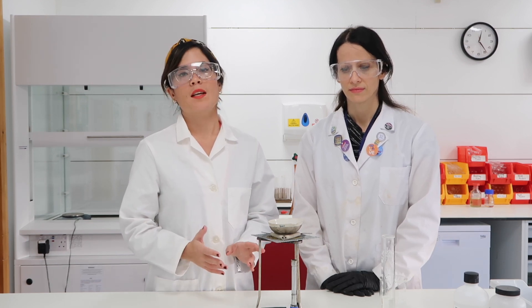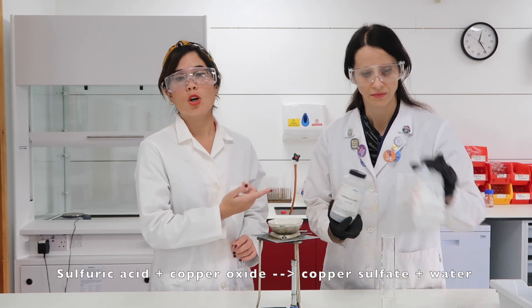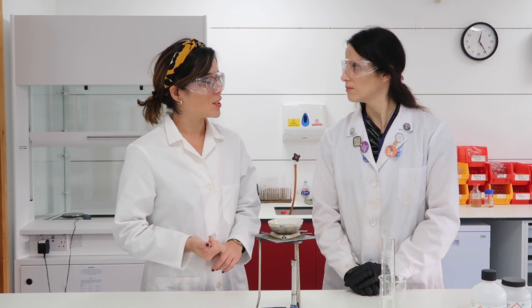However, we're going to be making copper sulfate, which is a soluble salt, and we're going to be using the crystallization method in order to do this. Make sure you watch the method really closely because it's really important that you get every single step in the right order. The two reactants we're using are sulfuric acid and copper oxide. Together, when they react, they produce the salt copper sulfate and water as a byproduct. Anyway, over to you Emilia.